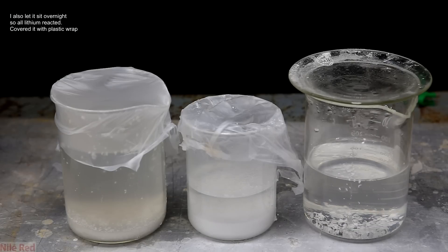After I was done, I was left with three different beakers. As I said before, this project ended up being a lot messier than I thought it would be, but I decided that this is how I would like the video to be. I like to show when things are realistic and how they don't always go as planned. So instead of reacting everything in one beaker, I'm left with three separate beakers with different concentrations of stuff.